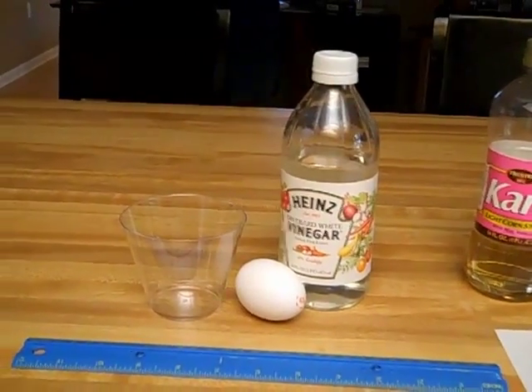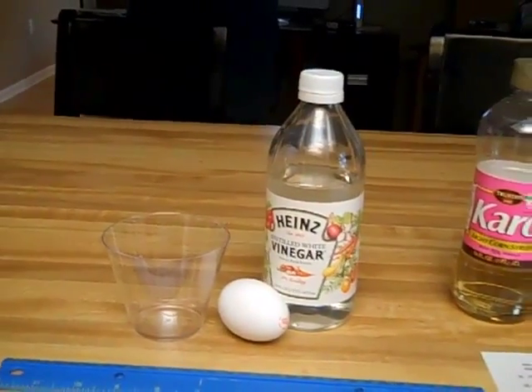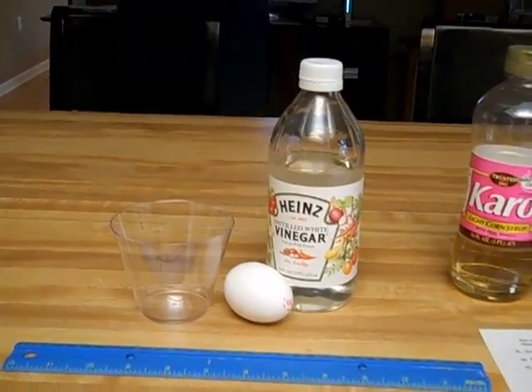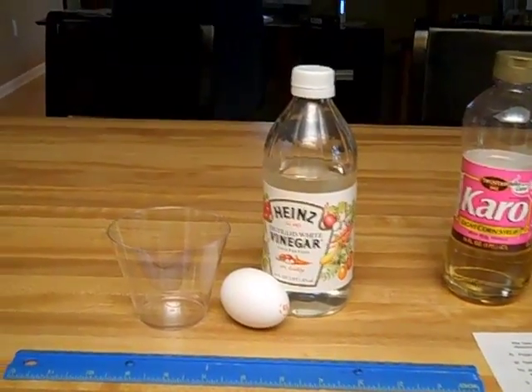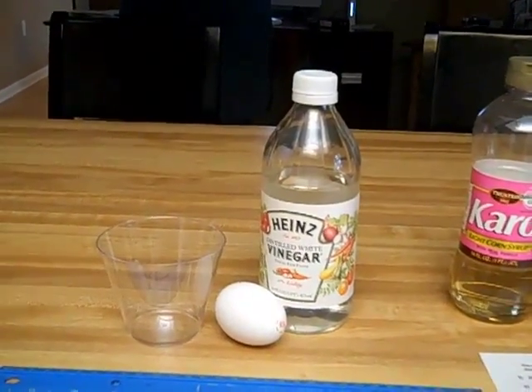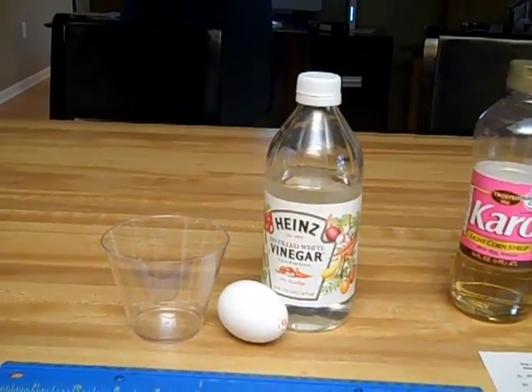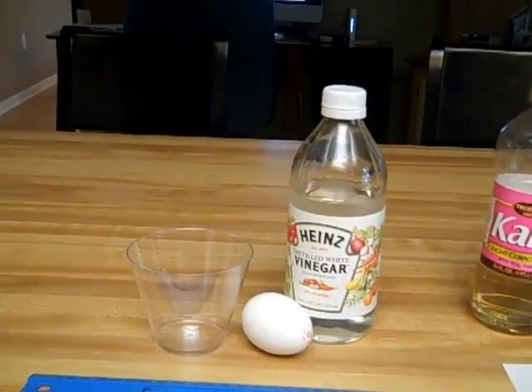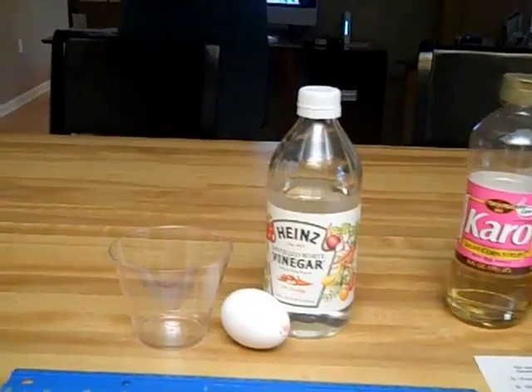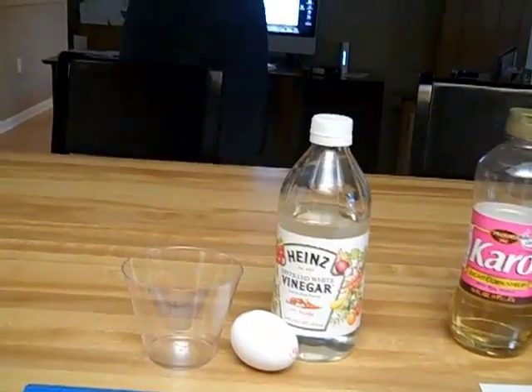We're going to hypothesize what's going to happen to the egg. If that cell membrane allows molecules to move in and out of it, and we know that diffusion — and osmosis specifically in this case — is molecules moving from a high concentration to a low concentration, then you need to hypothesize what's going to happen to the egg. Make your hypothesis, let's take a measurement of the egg, and let's get started.